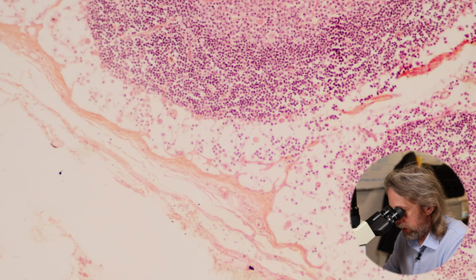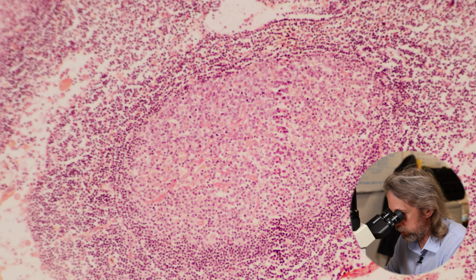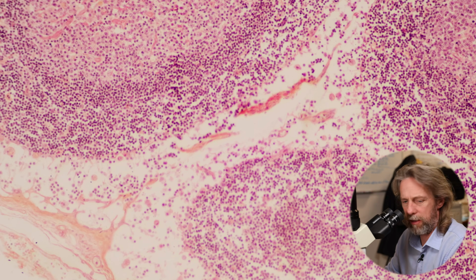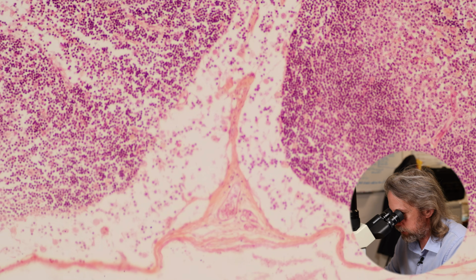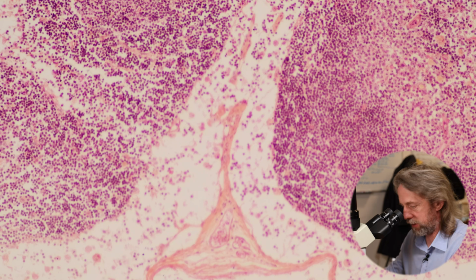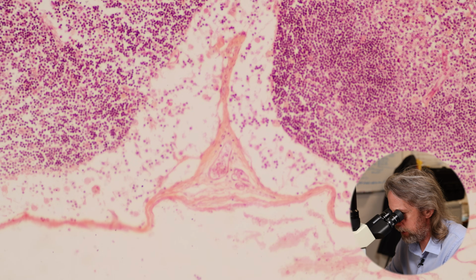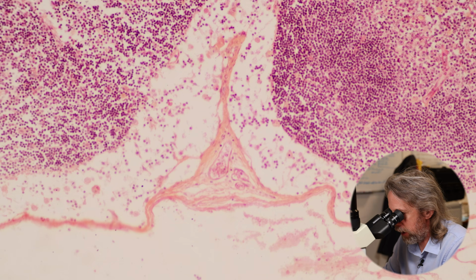And you can see, okay, so I said that these are the follicles or the nodules in the cortex, and then between them we're seeing these spaces. And you can see a bit of stain there. This one over here is a little bit better, but there are spaces extending into the cortex. These are real spaces. The capsule that's pushing there into the cortex, that's a trabecula, so plural trabeculae. And the space around them is a trabecular sinus.